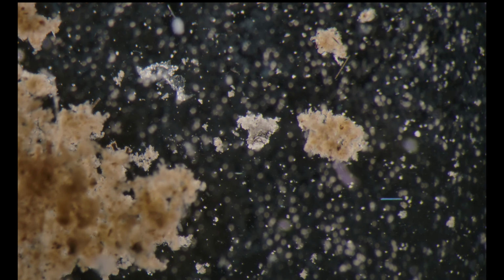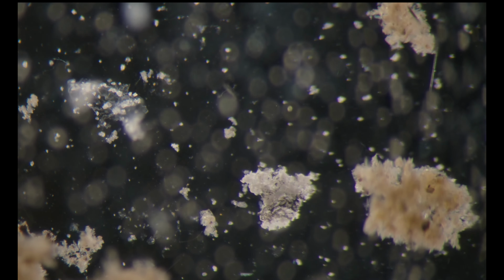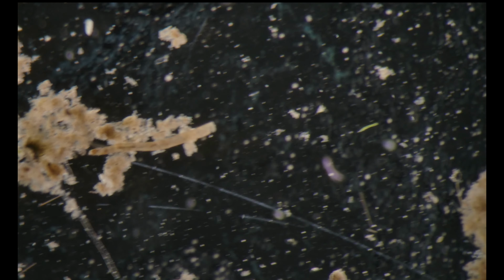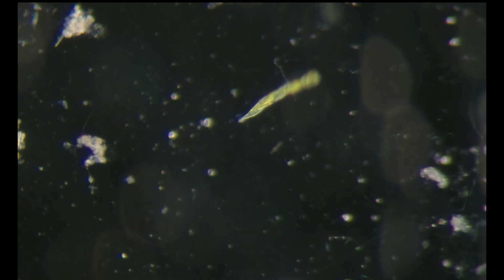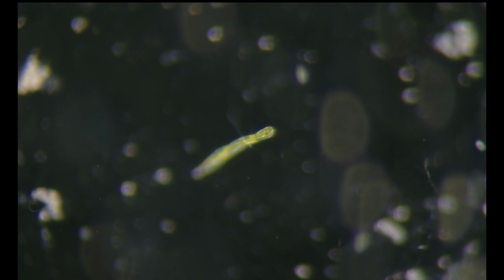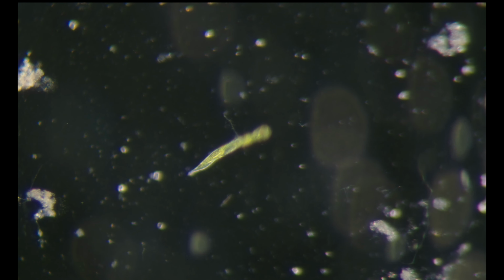Zoom out. Of course, the less water we're using, the much clearer the view, but then we'll have some problem of sucking with the micropipette.